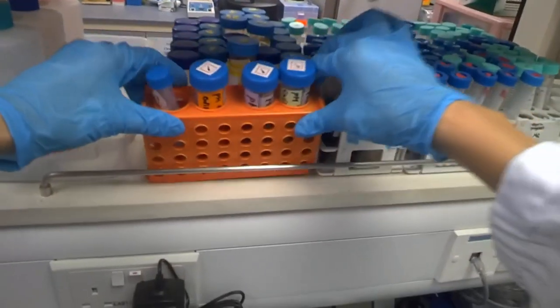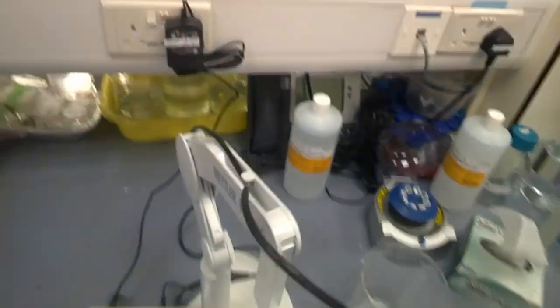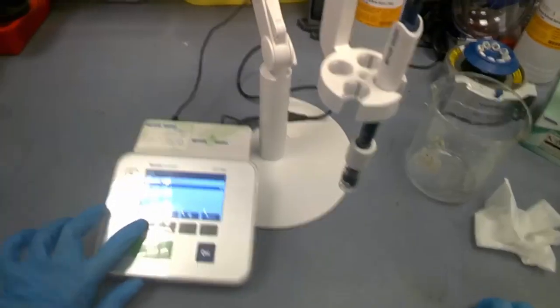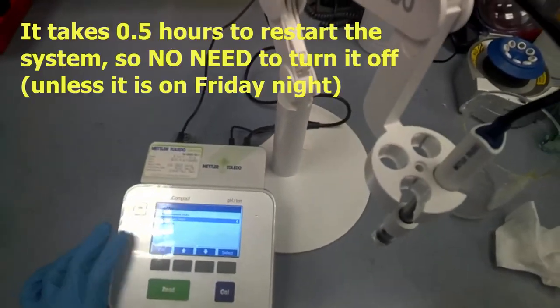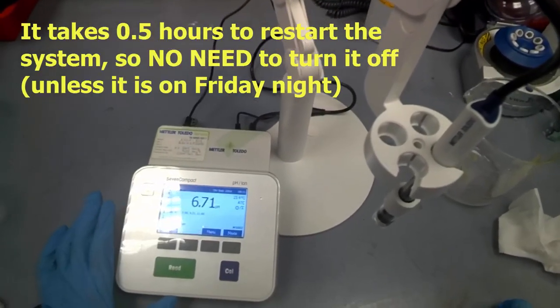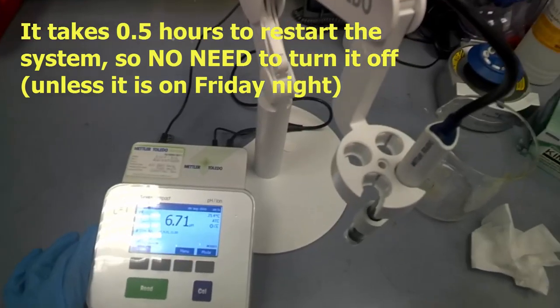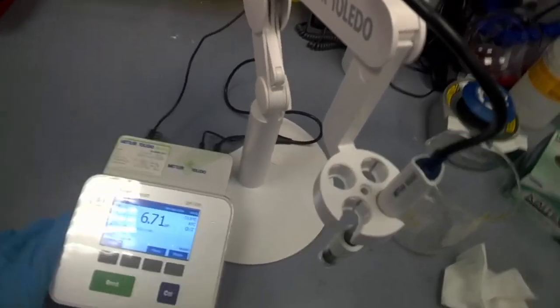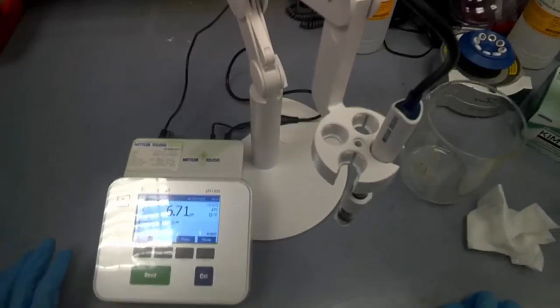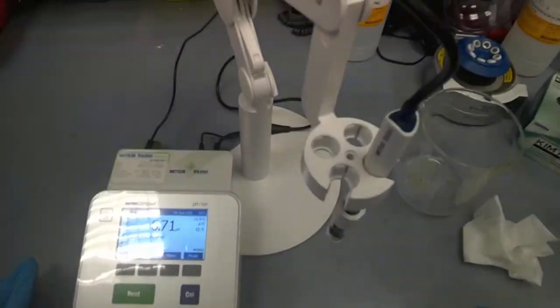Just now we put back the buffer at this location. If you are done for the day, you can turn off the pH meter. But let's say you are at the midday. No need. You do not have to turn it off because it takes about half an hour to restart the machine again, so the next user can just do it immediately. Stay safe and enjoy.